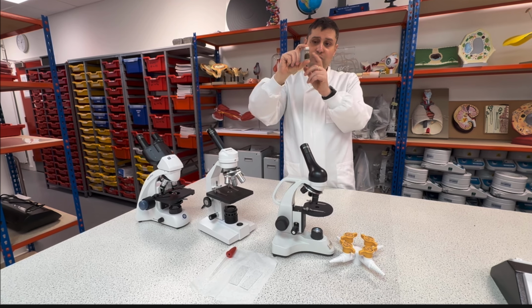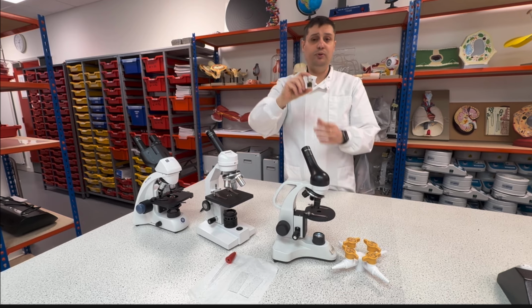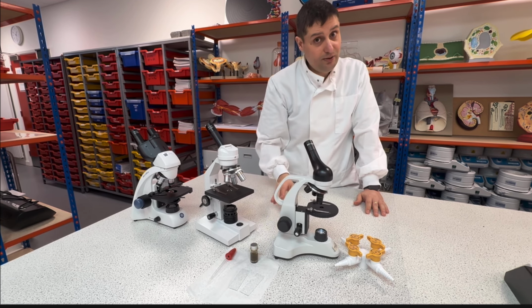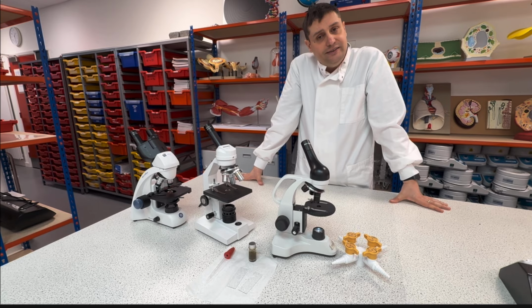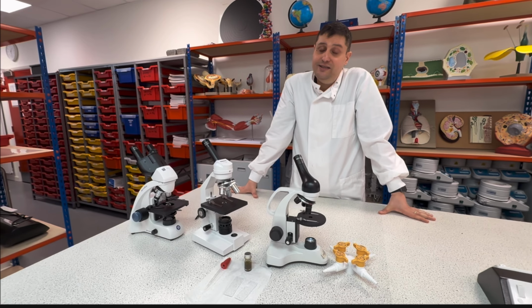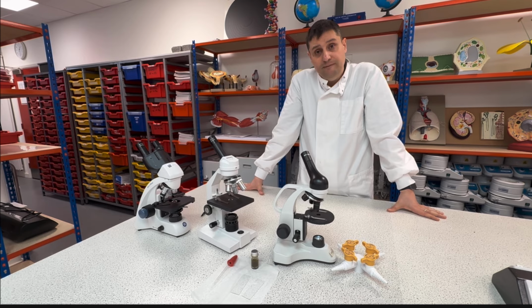Okay, so this water here will contain microorganisms. Can be protozoa, can be even small animals, can also be algae, plants. So it depends how clean the place is. Not clean in terms of dirty, but clean in terms of pollution.